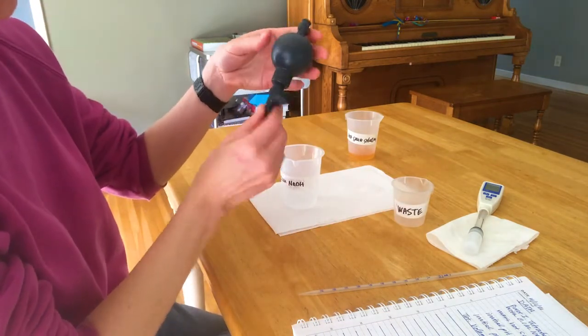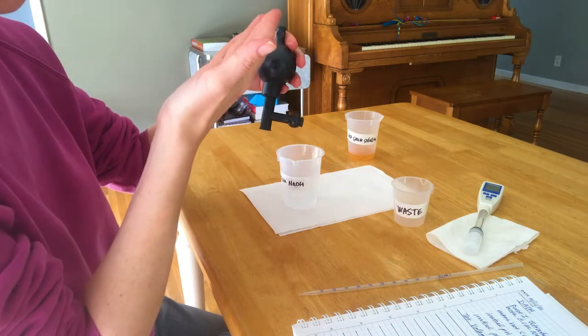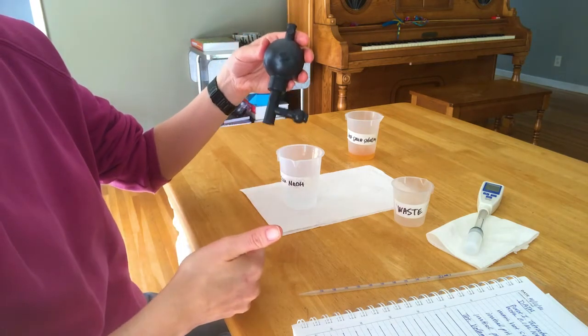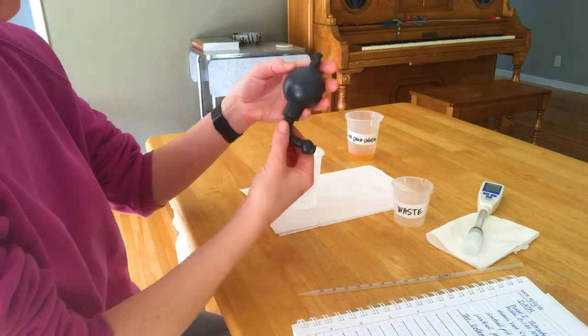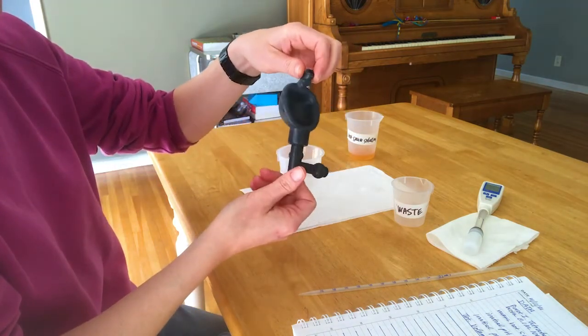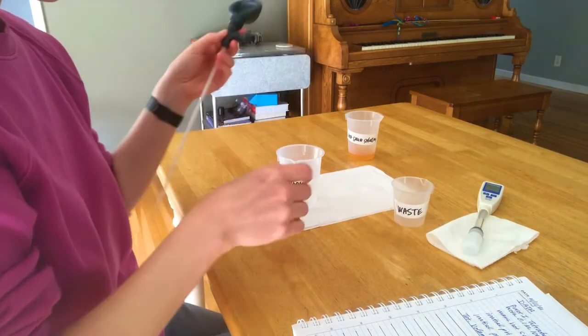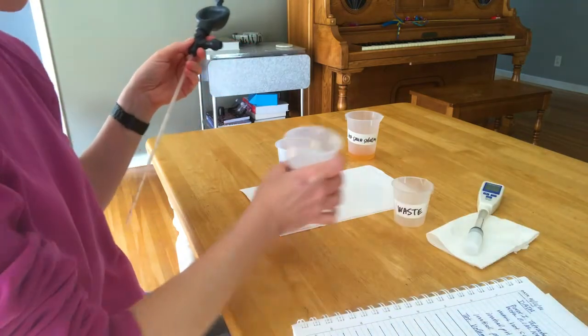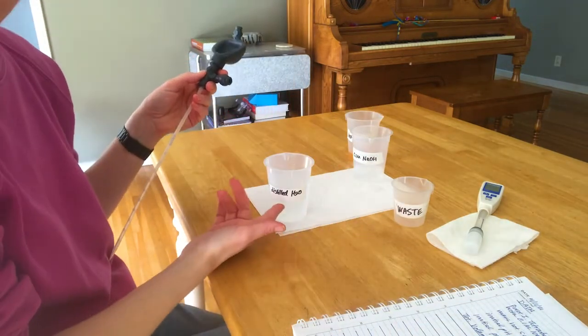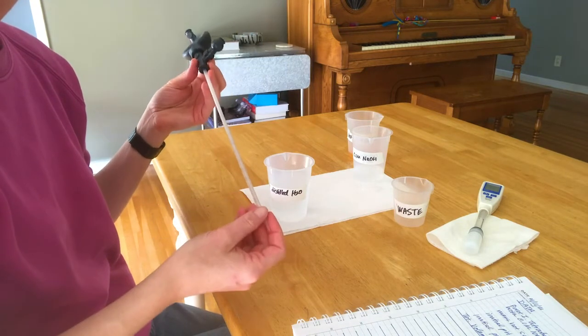This is a two-way bulb. It's got a valve that says S for suction. That's if you want to suction liquid up or air. And then there's another valve that says E, which is if you want it empty. First of all, press the S valve while you squeeze the bulb so that it's ready to suction up the liquid. Place it on top of the pipette. And then you always want to, well usually, rinse your pipette with distilled water first, just to remove any contamination that was there before. I've already done that step.